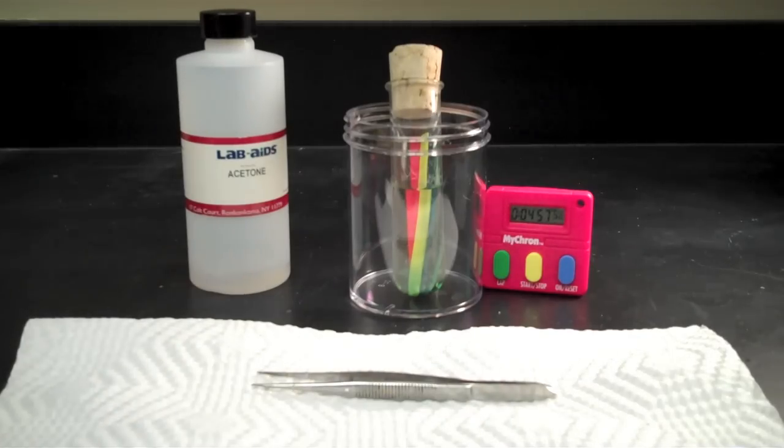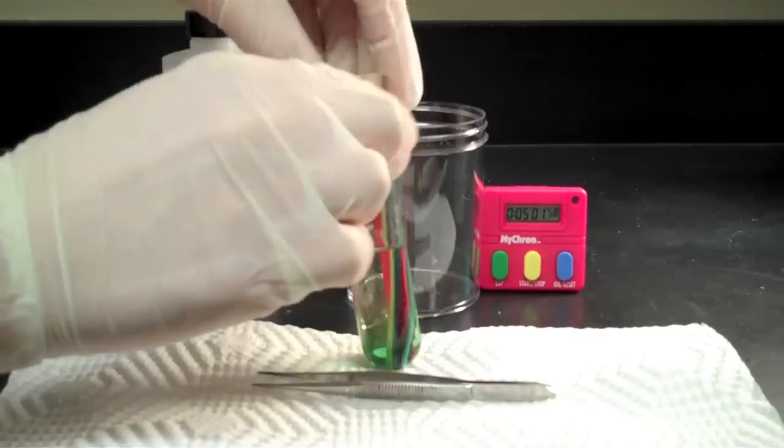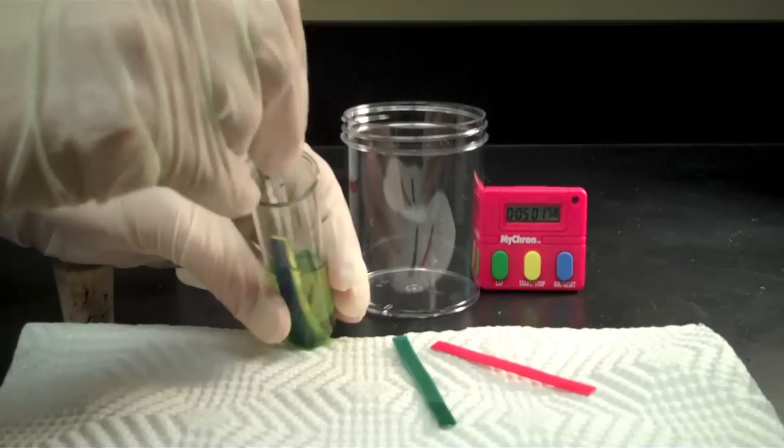After five minutes, we will remove the strips from the test tube and observe the characteristics of each strip.